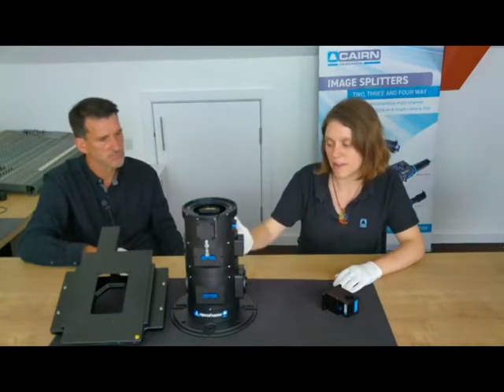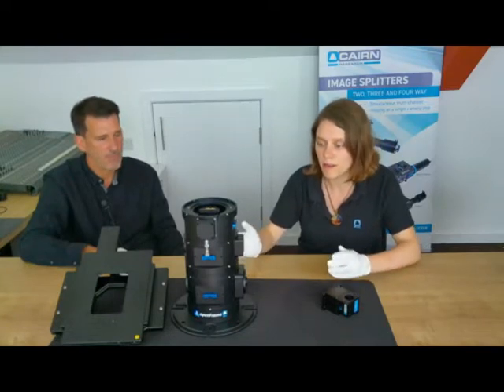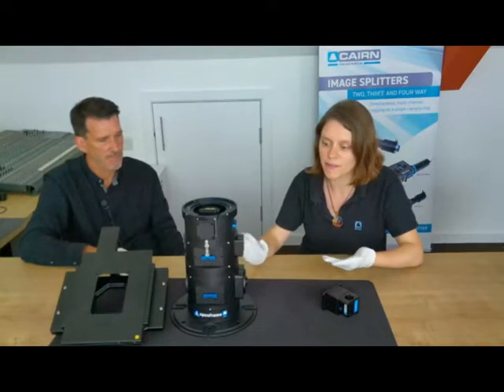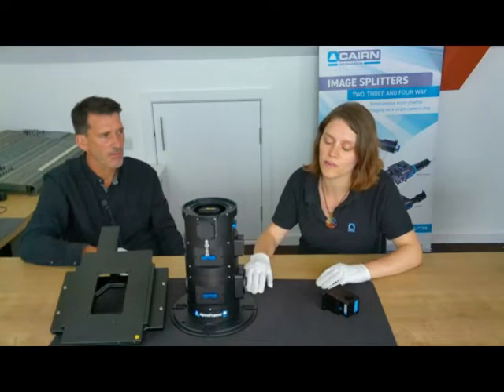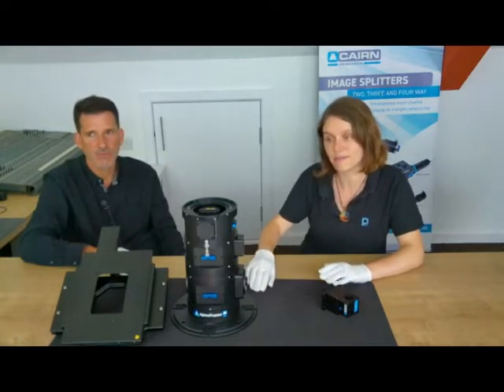Below that we've got the smaller 30mm layer, this houses the tube lens. We're currently working with a range of options, predominantly the large field of view Nikon and Olympus, as well as a range of Thorlabs tube lenses, and we're also working on designing our own one.